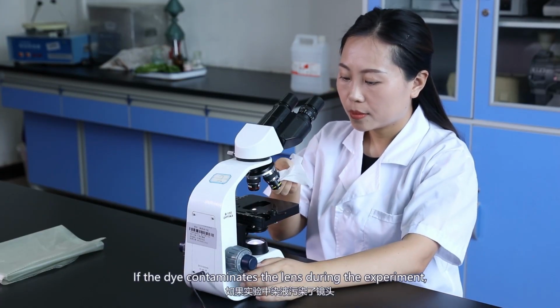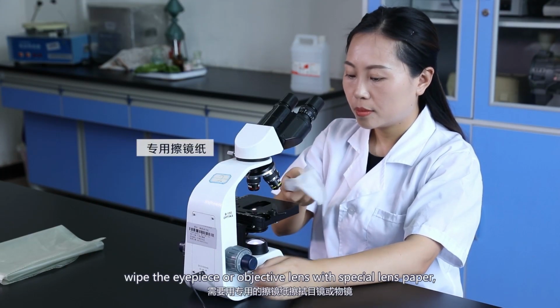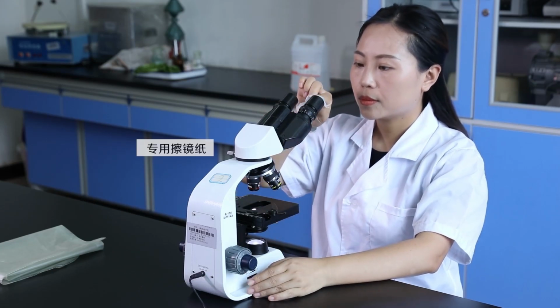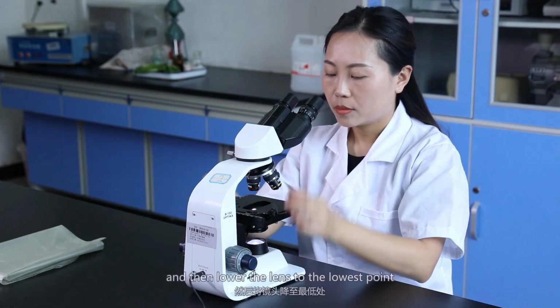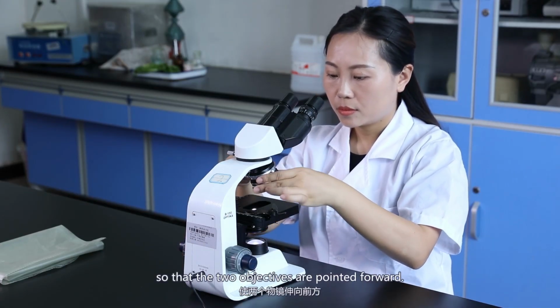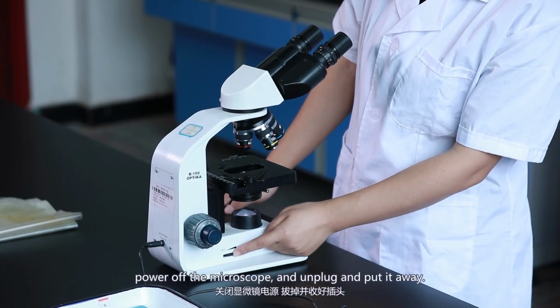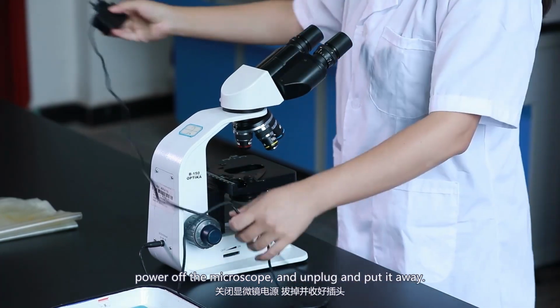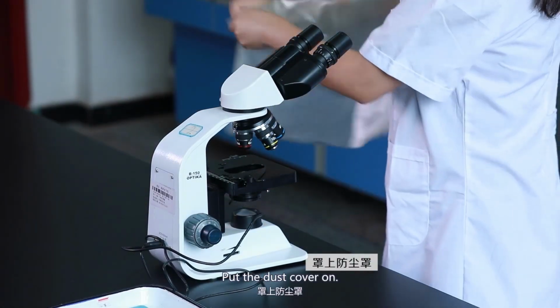If the dye contaminates the lens during the experiment, wipe the eyepiece or objective lens with special lens paper. And then lower the lens to the lowest point so that the two objectives are pointed forward. Turn the light to the dimmer setting, power off the microscope, and unplug and put it away. Put the dust cover on.